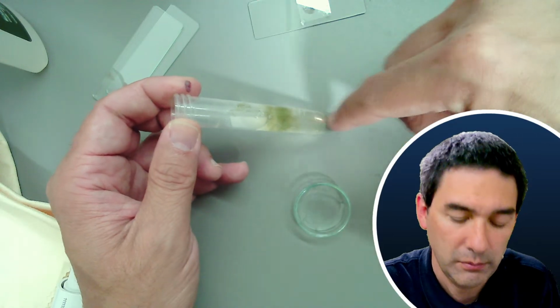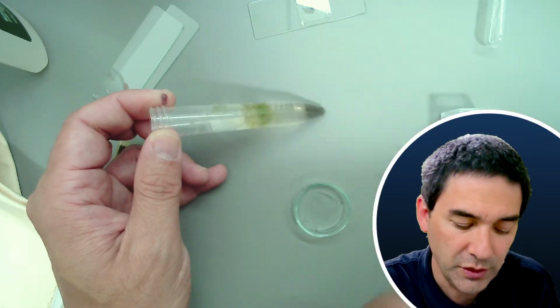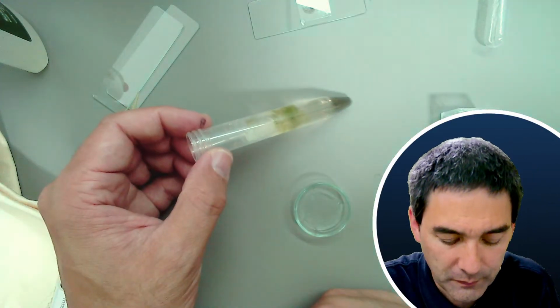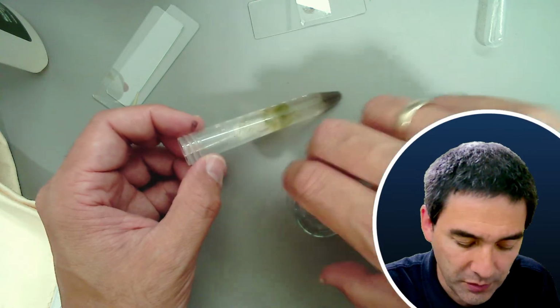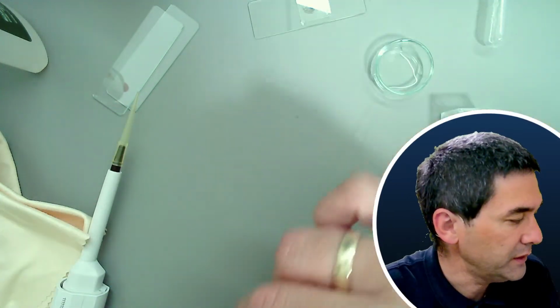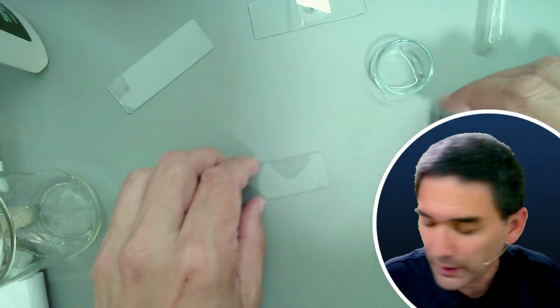Some algae, some pond water, you see some sediment down here as well, and I simply left it standing open like this for a month now. Okay, and let's put a little bit of this under the microscope as well, because I did find out that there is still quite a lot of life here. So I just thought, why not?